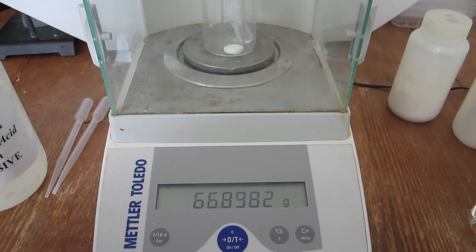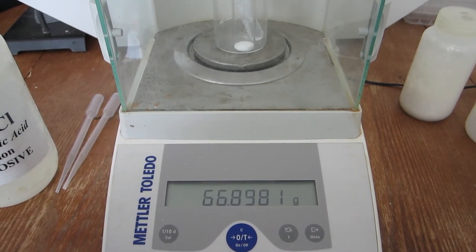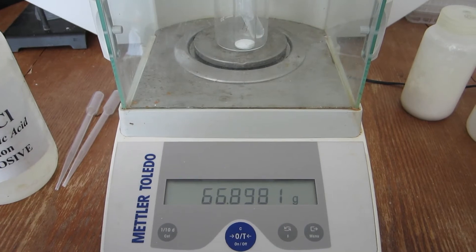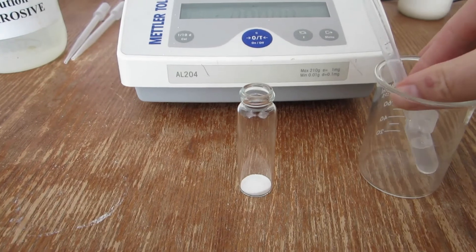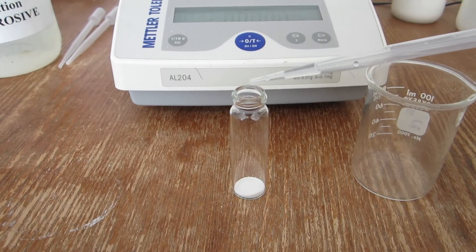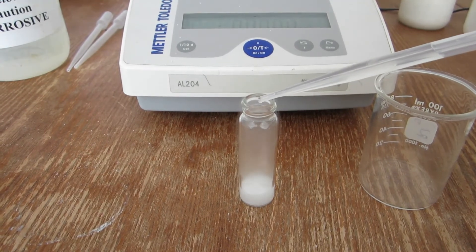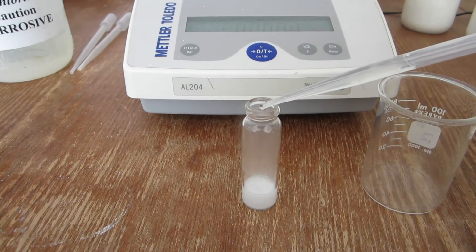In the first trial, the combined mass of the vial, beaker, acid, and sample is displayed. This is the mass before the reaction. As with the other samples, the acid is added to the carbonate slowly. This prevents the carbon dioxide from overflowing out of the vial and causing errors in the result.